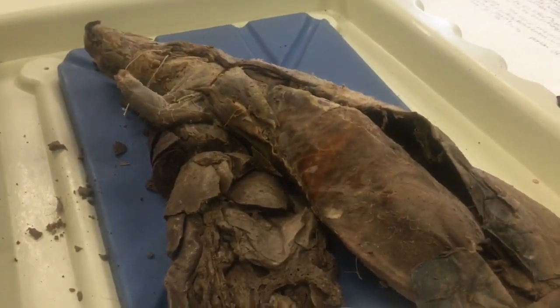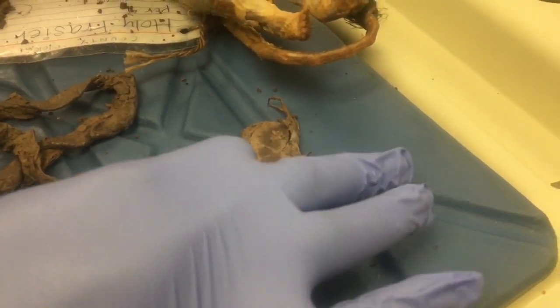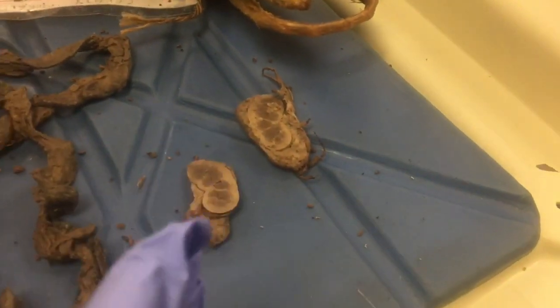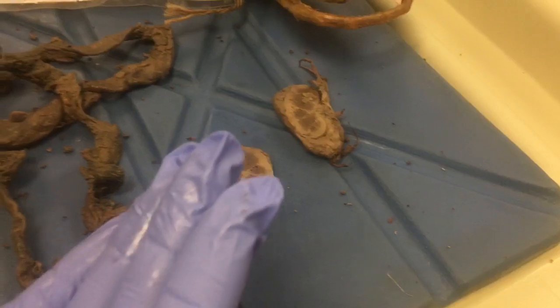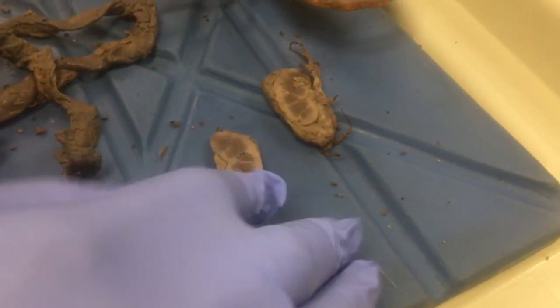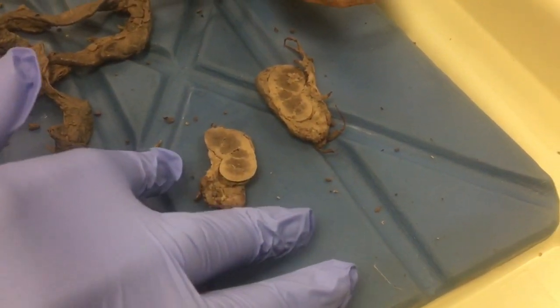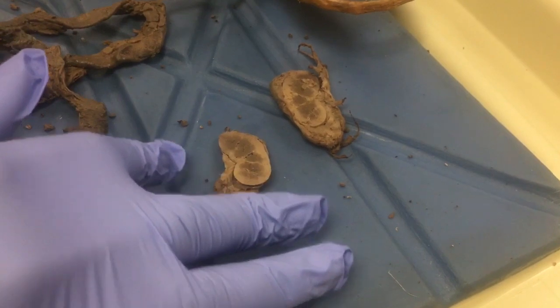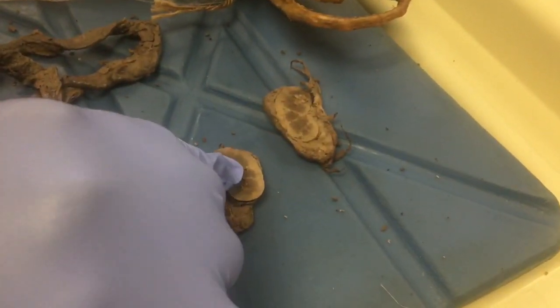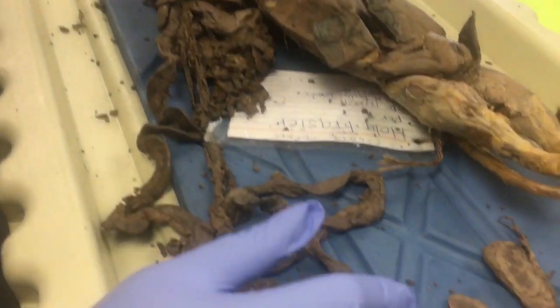When we talk about the kidney, I want to bring your attention to right here, mainly this kidney right here. The kidney helps filter the human blood. One interesting thing to know is that people get on dialysis whenever the kidneys can't filter out the bad toxins or retain the good stuff. The renal medulla is the second most inner part of the kidney. Blood enters into the kidney through the renal artery.